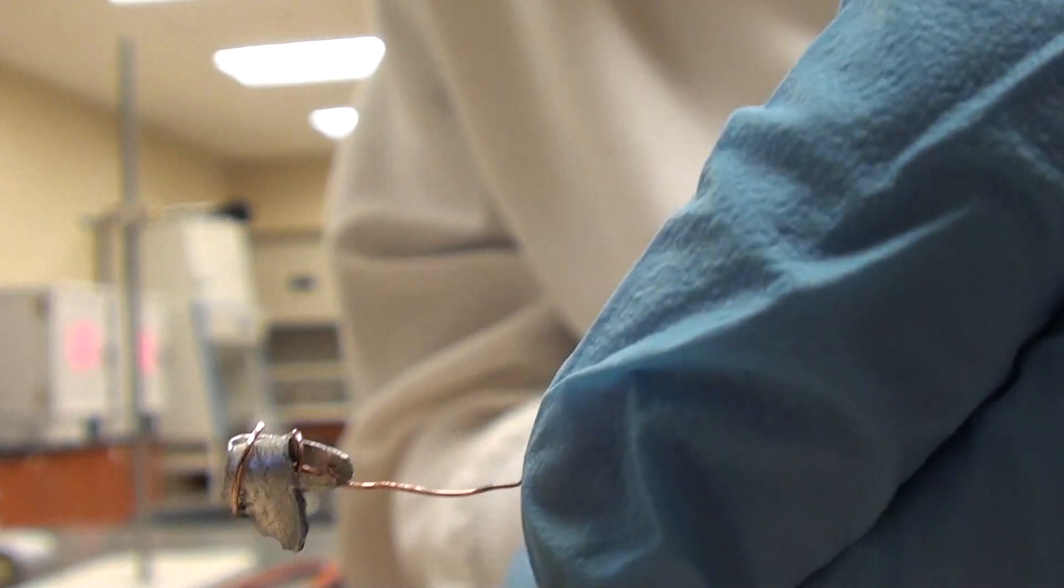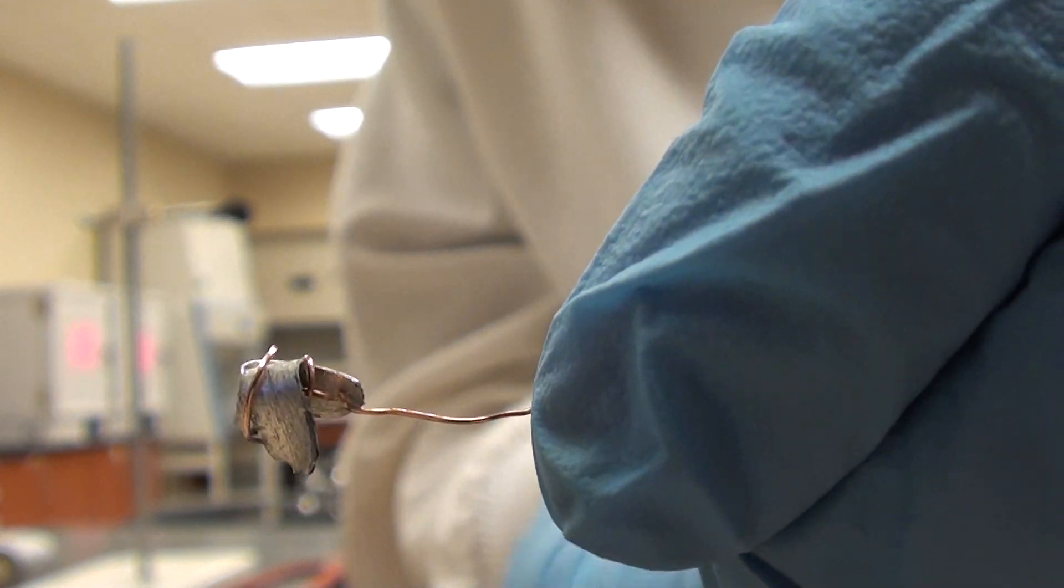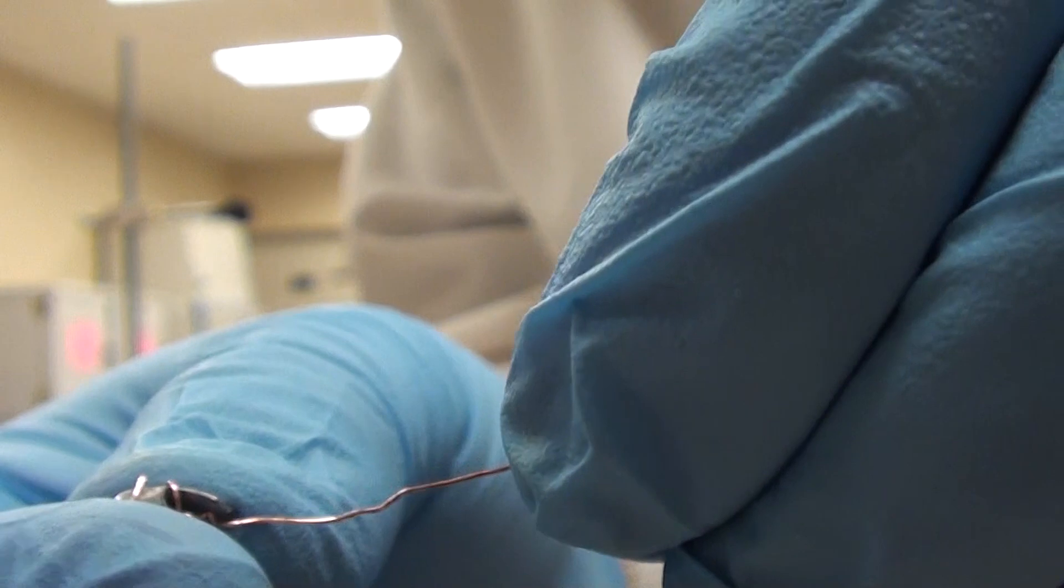So this is what I've got so far. Now I'm going to take some of this bottom part here, not very much of it mind you. I still want to be left with an appreciable length at the end, a fair amount at the end here, so that I can stick that into the eudiometer tube. So just maybe about this much. That's what I'm going to wrap around the bottom of the magnesium here.